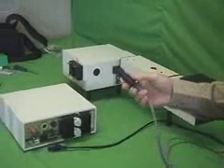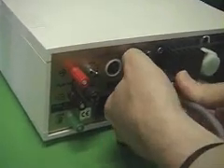Take the male end of the cable, plug it into the female connector on the igniter connector on the back of the LPS 220B power supply. Again rotate it until you feel it pop in. Then you can turn the black plastic ring on it and turn that in so it is locked securely in place.